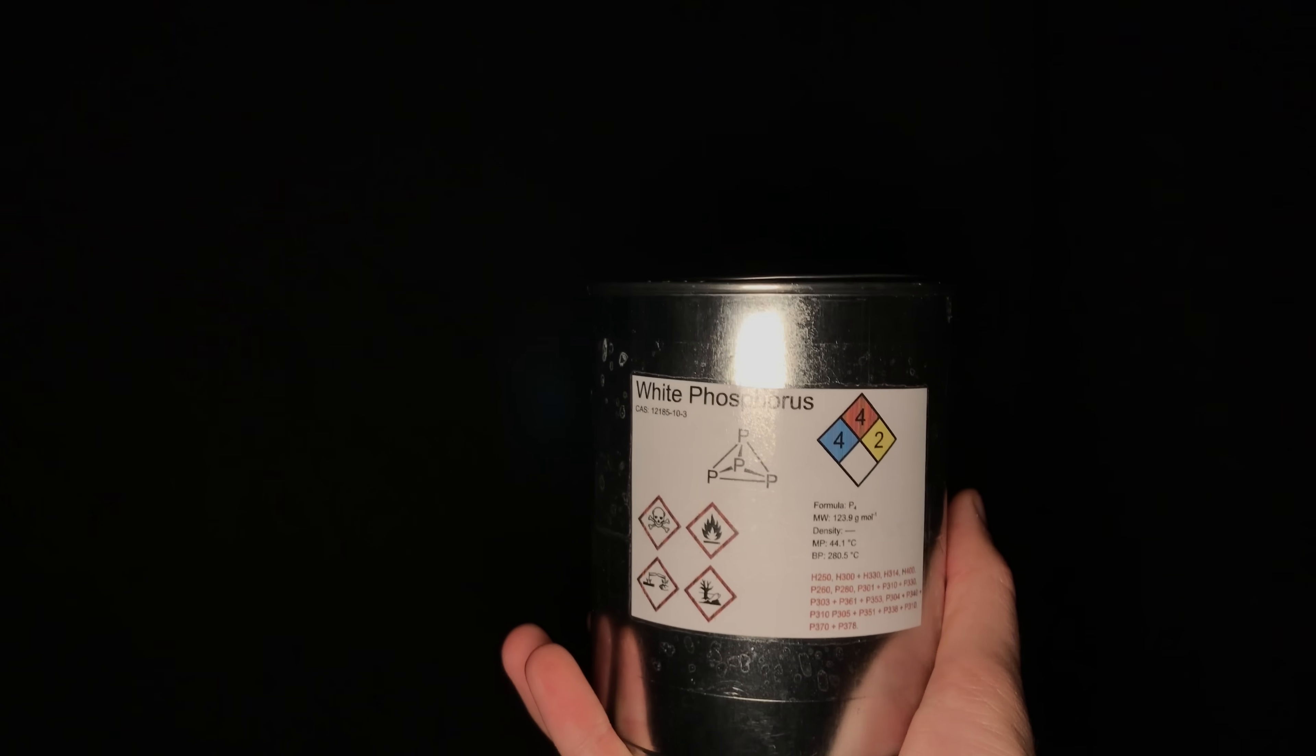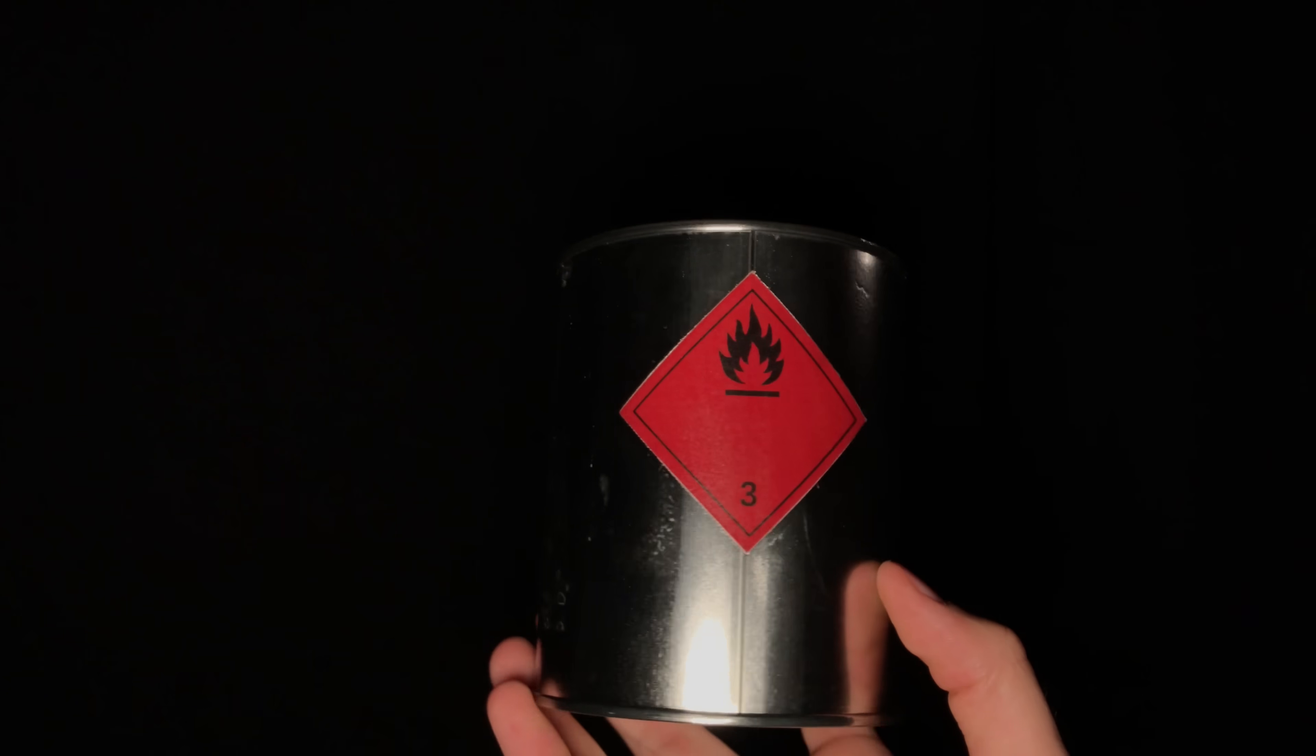As white phosphorus can self-ignite, the glass bottle was packed into a secondary container just in case it broke.